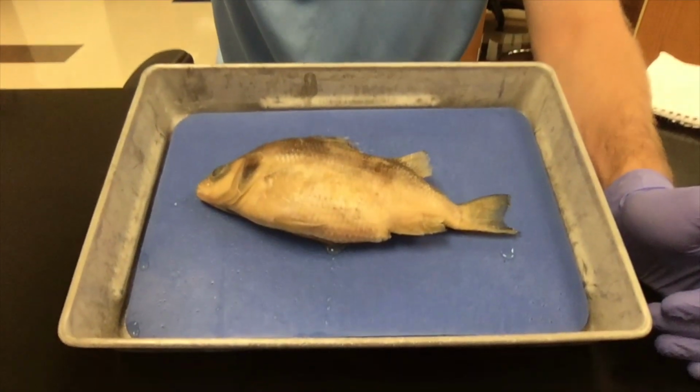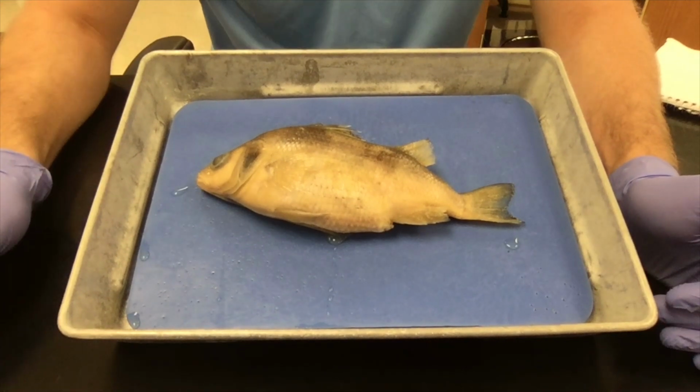Hello everyone, today we are going to be doing our fish dissection. We are going to use this video as our primary means of learning the different characteristics that make fish, fish. Alright, the fish we're going to be dissecting today is a perch. Perch are commonly found in the northern United States.